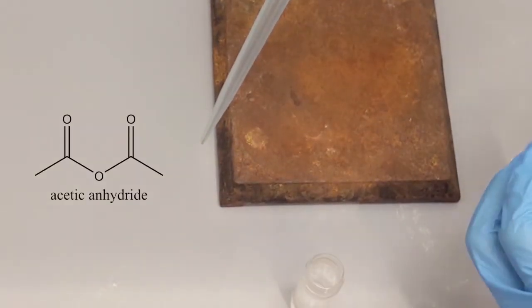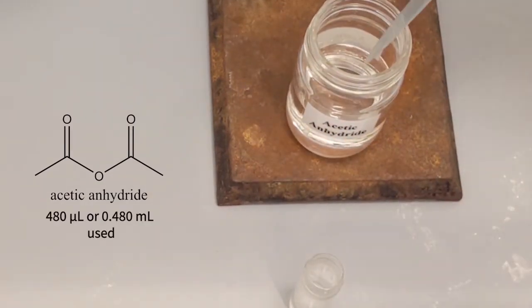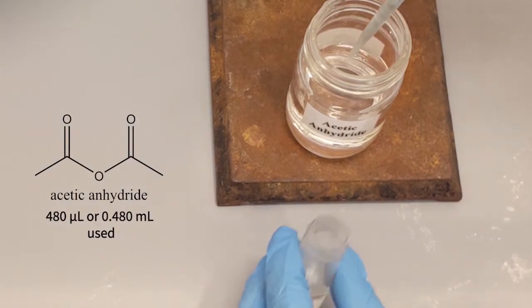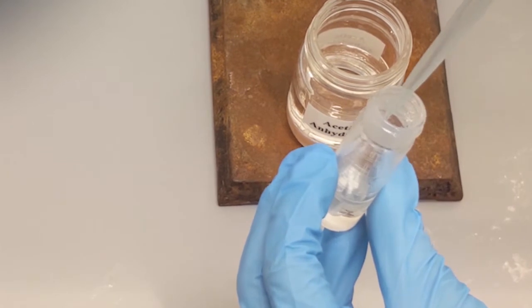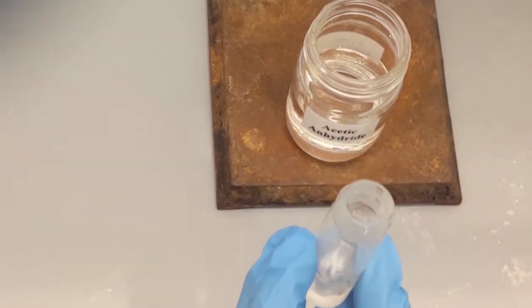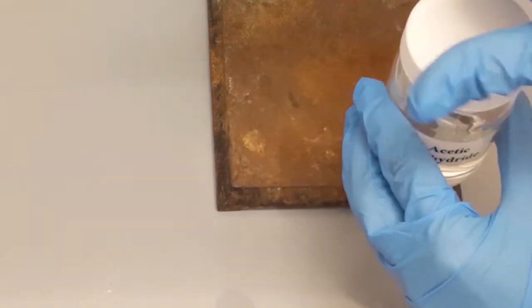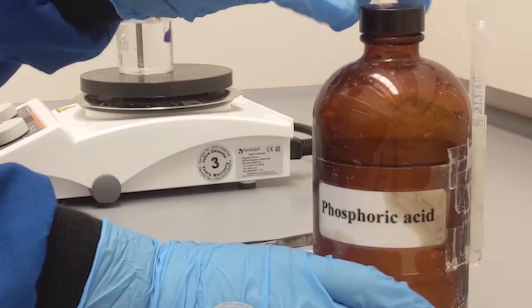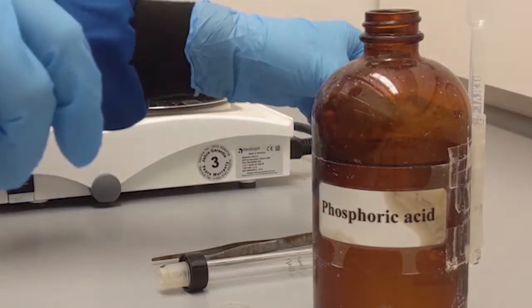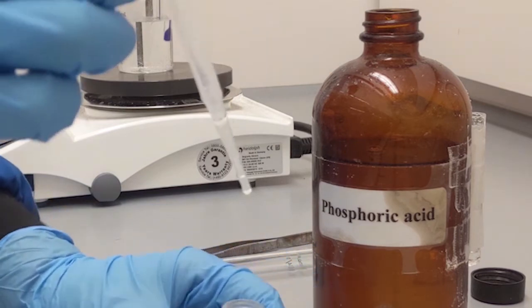And then we add 0.48 milliliters of acetic anhydride with the help of a micropipette. After this, we continue by adding 1 drop of phosphoric acid into the conical vial that contains our mixture.